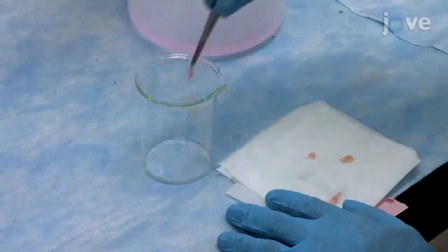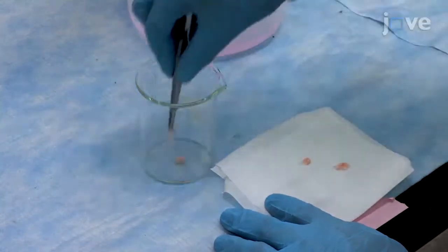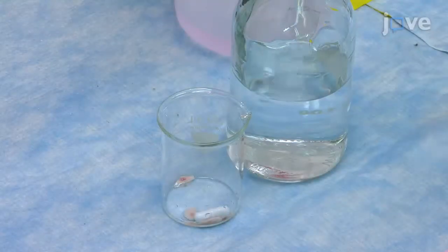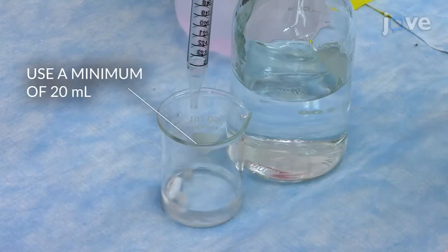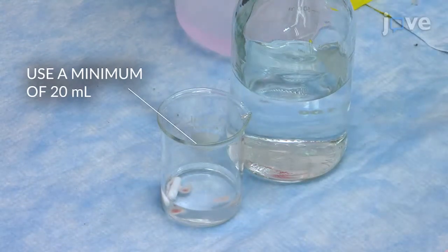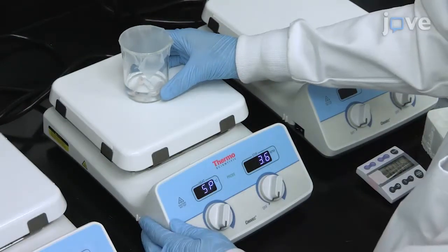Place the dried tissues in a pre-autoclaved beaker containing an appropriate-sized stir bar, and cover the tissues with 60 ml of 3% T-octyl phenoxy polyethoxyethanol per gram of tissue. Stir for 1 hour at room temperature.